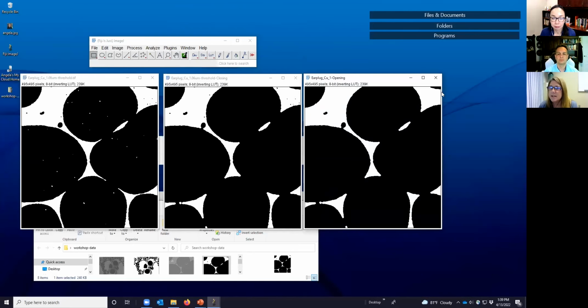All right. So now we see these little islands within the polymer. They're gone. And as a matter of fact, so are our holes within the voids. And that's because we're following erosion with the dilation. So that kind of gives you an idea. But again, we still are stuck with these extra connections between our void pockets that we don't want.